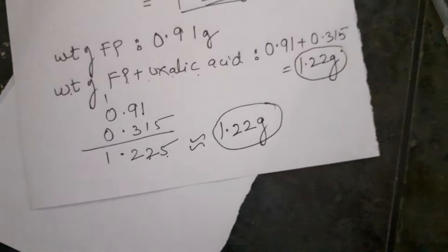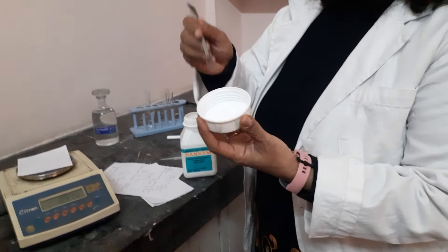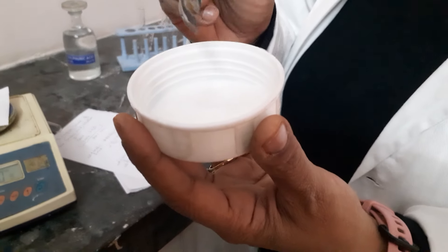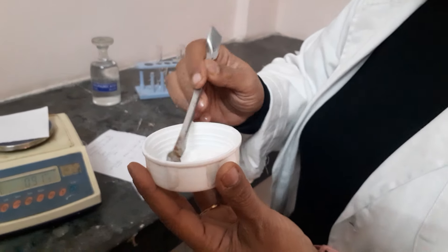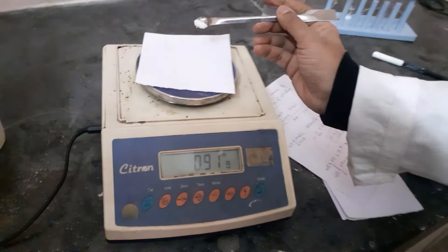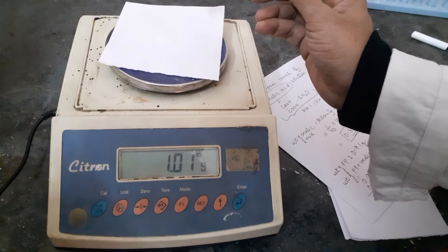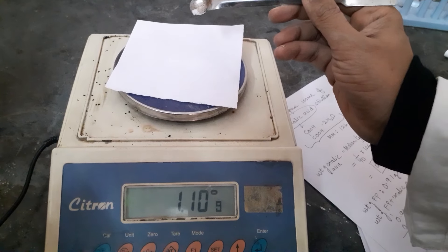If it goes slightly over, don't worry. Now, about the oxalic acid — this is the bottle from which you will be using the salt. Oxalic acid is a white, crystalline salt. It is crystalline because it has two water molecules. It is white because it has no transition metal. Add it carefully until it reaches 1.22. There is very little amount, so add it very carefully. If it goes slightly over, removal is difficult, so go slowly and let the value increase.